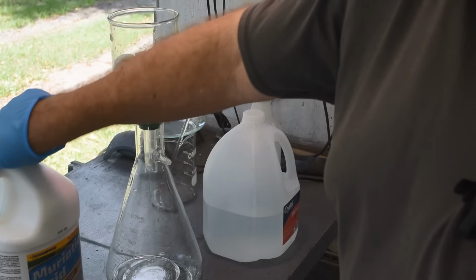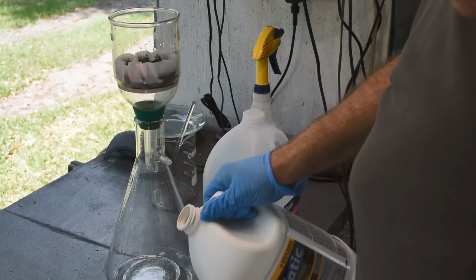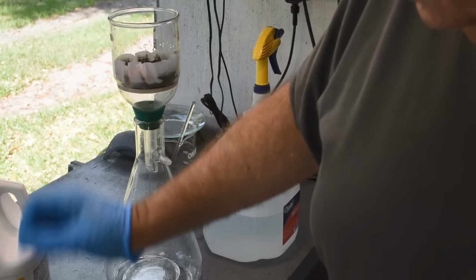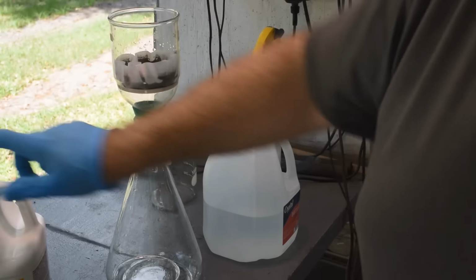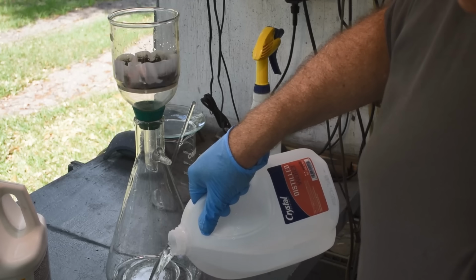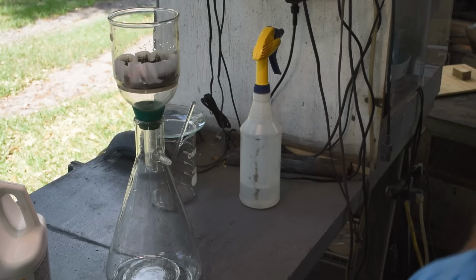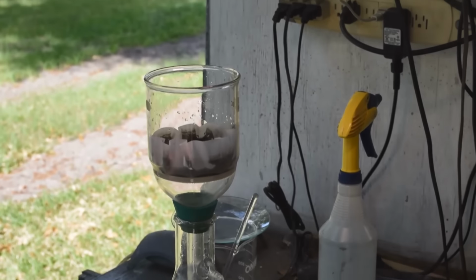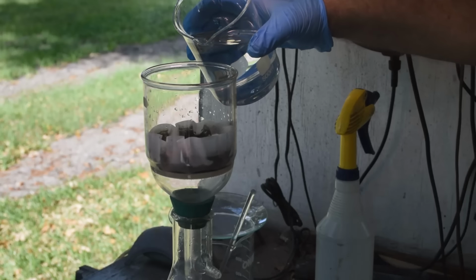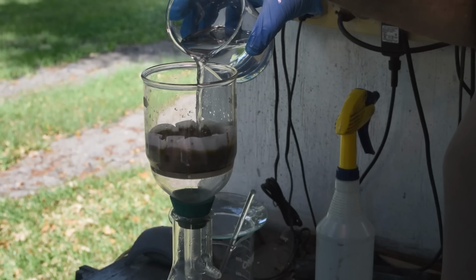So I've got some muriatic acid here. I'm going to make up a 50-50 mixture of muriatic acid and distilled water. There's about 200 milliliters of muriatic acid. Put in about 200 milliliters of distilled water. I'm going to put our mixture right in here. I'm not going to use the vacuum to pull it through. I'm just going to let gravity do it.